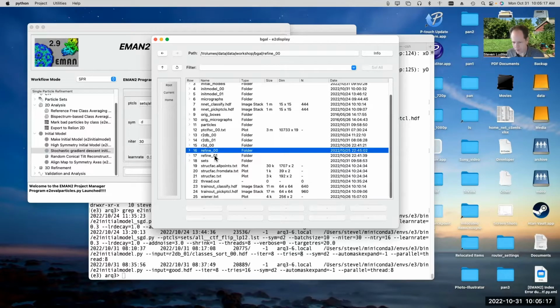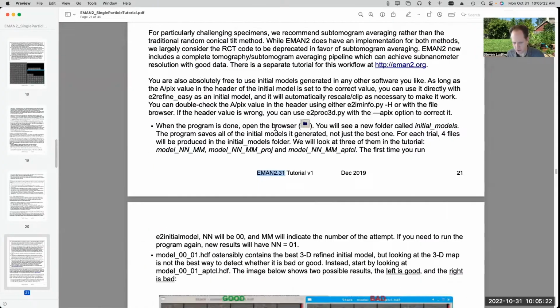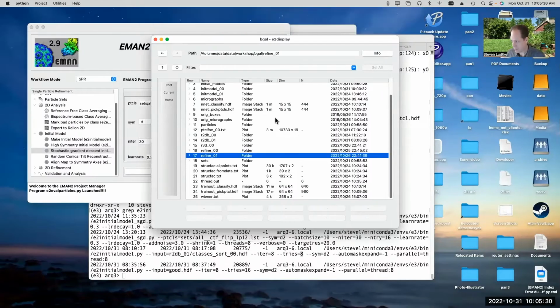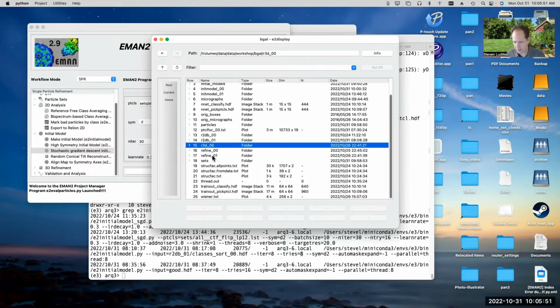So refine 00 and 01 are kind of following the canonical refinement strategy, which is outlined in the tutorial here. We'll skip through all this. Yeah, 3D refinement. I have a slightly better computer than the one we assume that people have in the workshop, so I maybe ran a little bit longer with a little bit more aggressive parameters in these two. So this is actually targeted to be a fairly high resolution refinement, and this was targeted to be sort of an intermediate refinement. But anyway, I ran two refinements here, and I also ran one of the new style refinements. So we can take a look at the results of all of these different things.